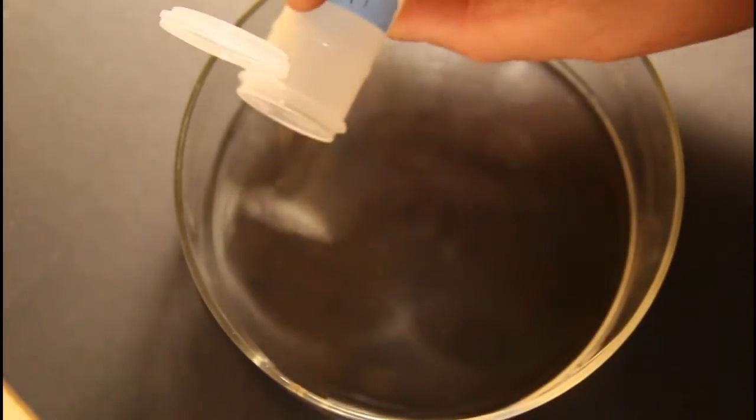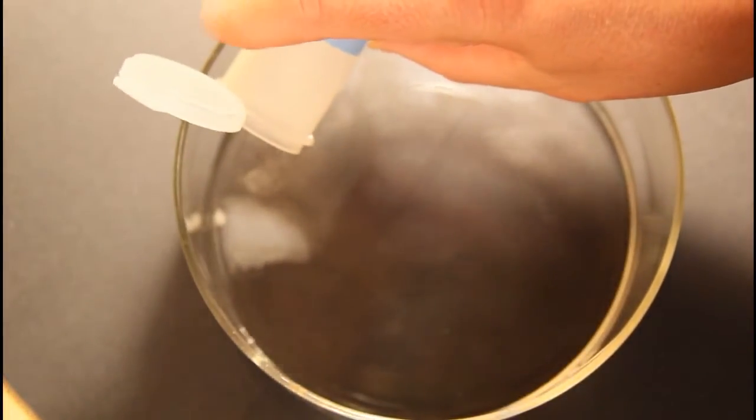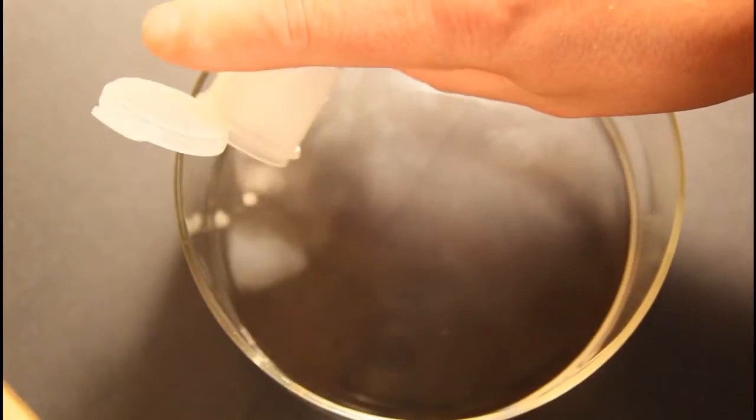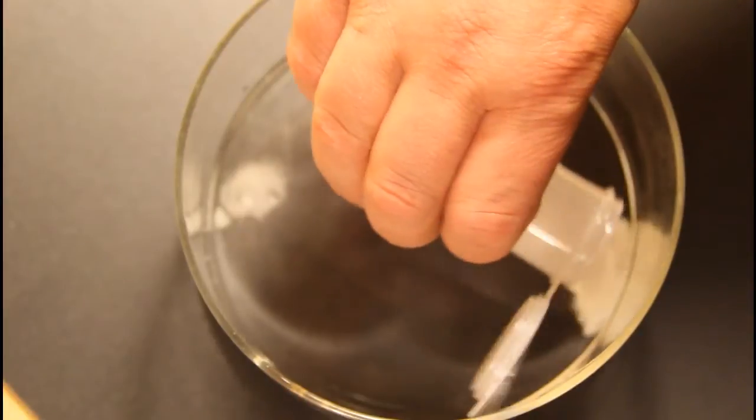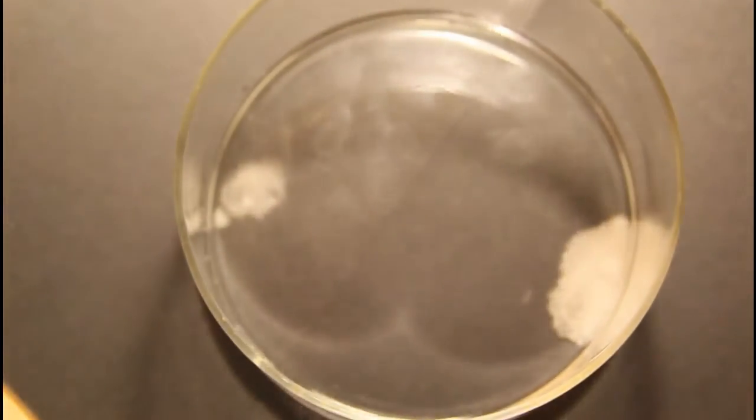I'm just going to add a little bit of potassium chloride over on this side and way over here some silver nitrate. Just watch what happens as they dissolve and diffuse through.